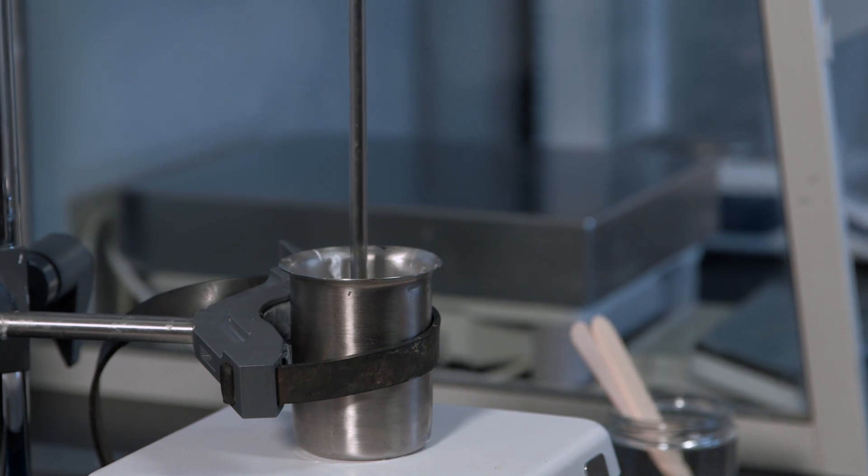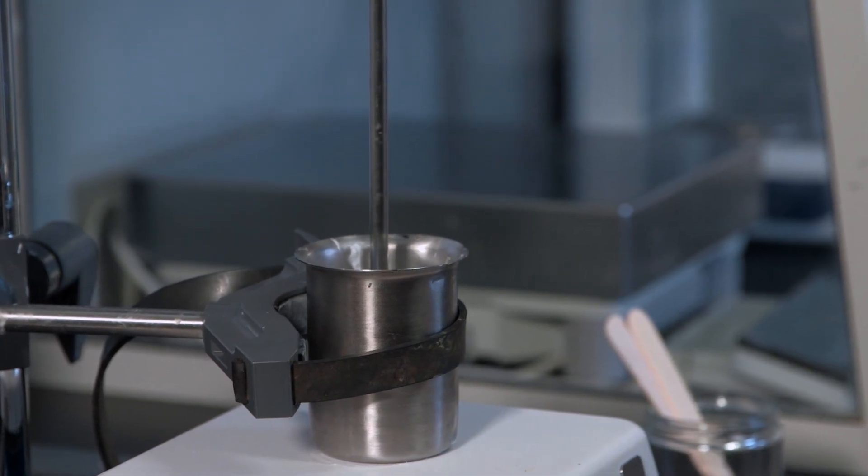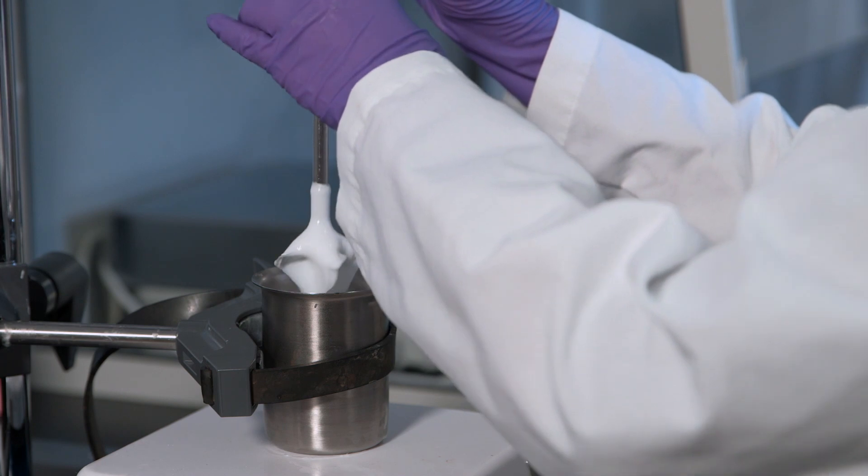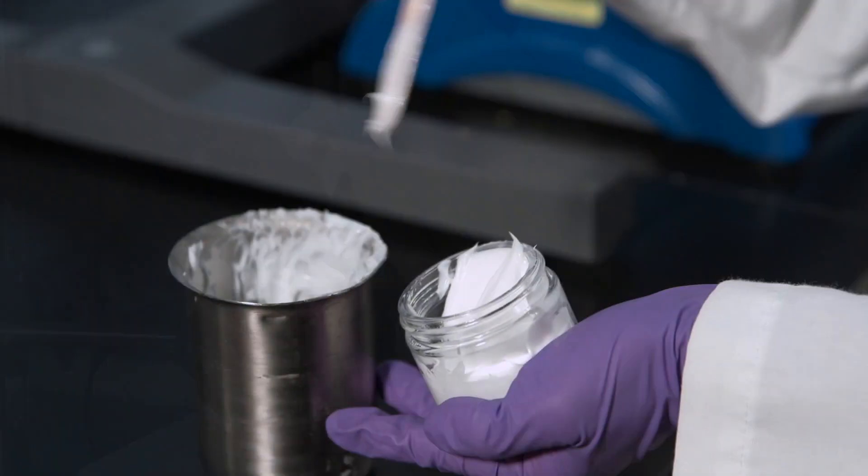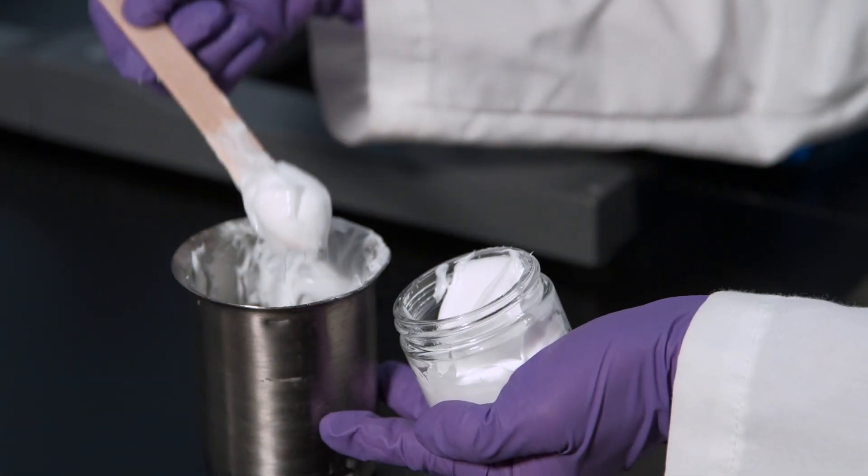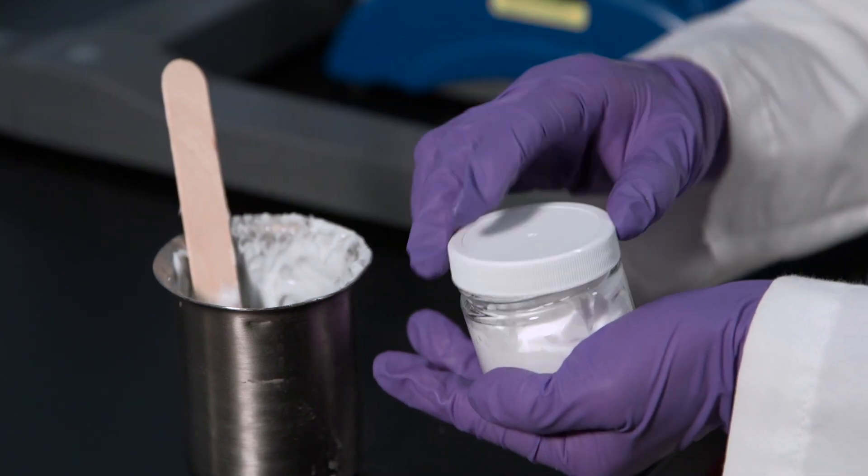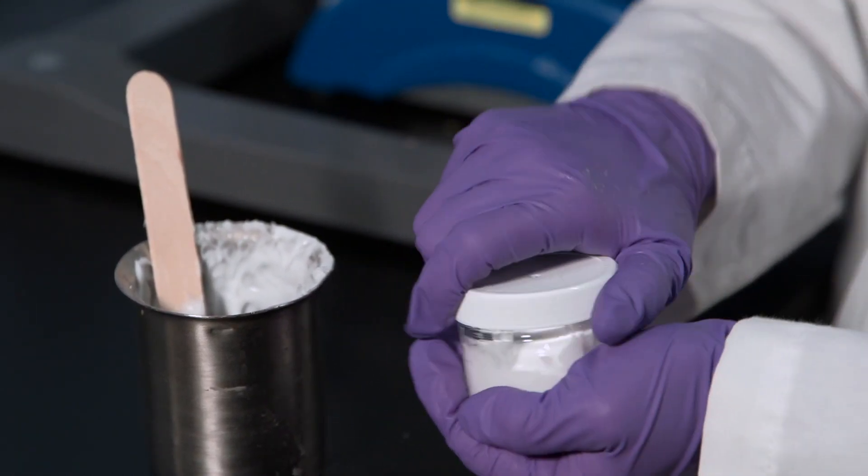This would also be the point in the formulation that a preservative would be added. Once the formulation has cooled, it is then transferred to an airtight container where it is maintained for at least 48 hours prior to analysis.